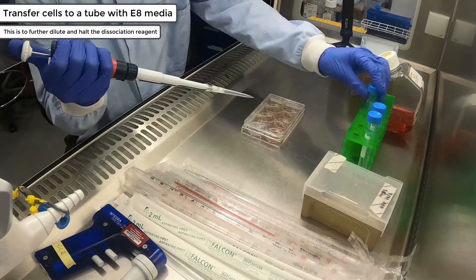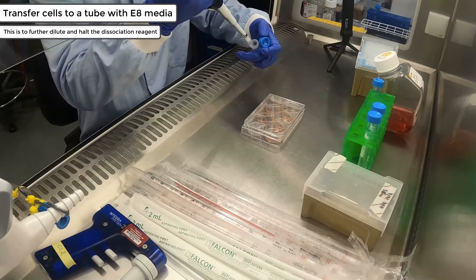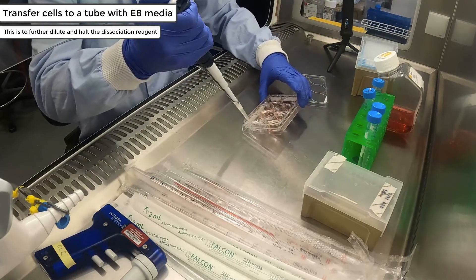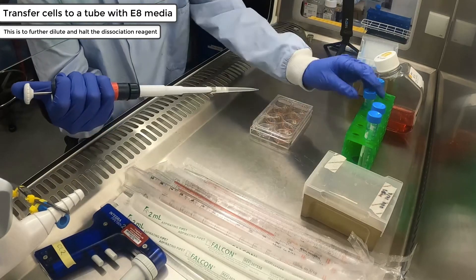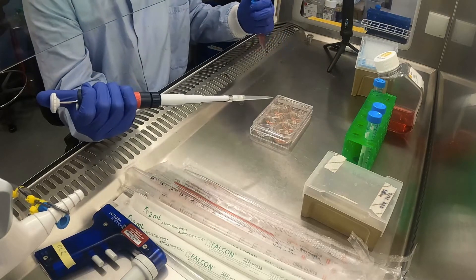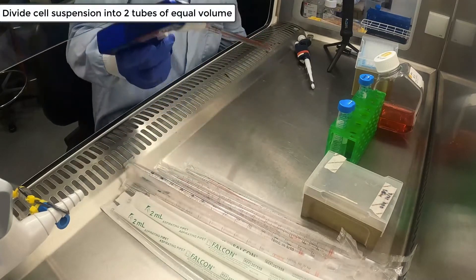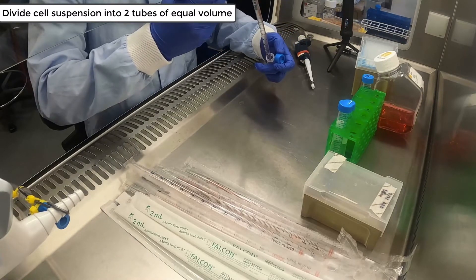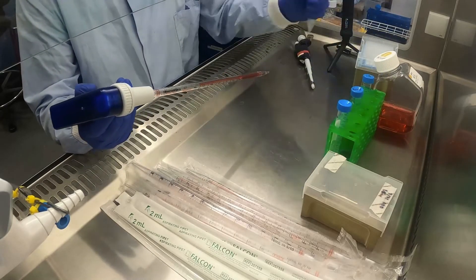Transfer your cells to a prepared falcon tube containing 6ml of E8 media. We are now dividing the cell suspension into two falcon tubes of equal volume. For the purposes of demonstration, half will be grown in E8 plus rock inhibitor and the other half will be grown without any rock inhibitor.